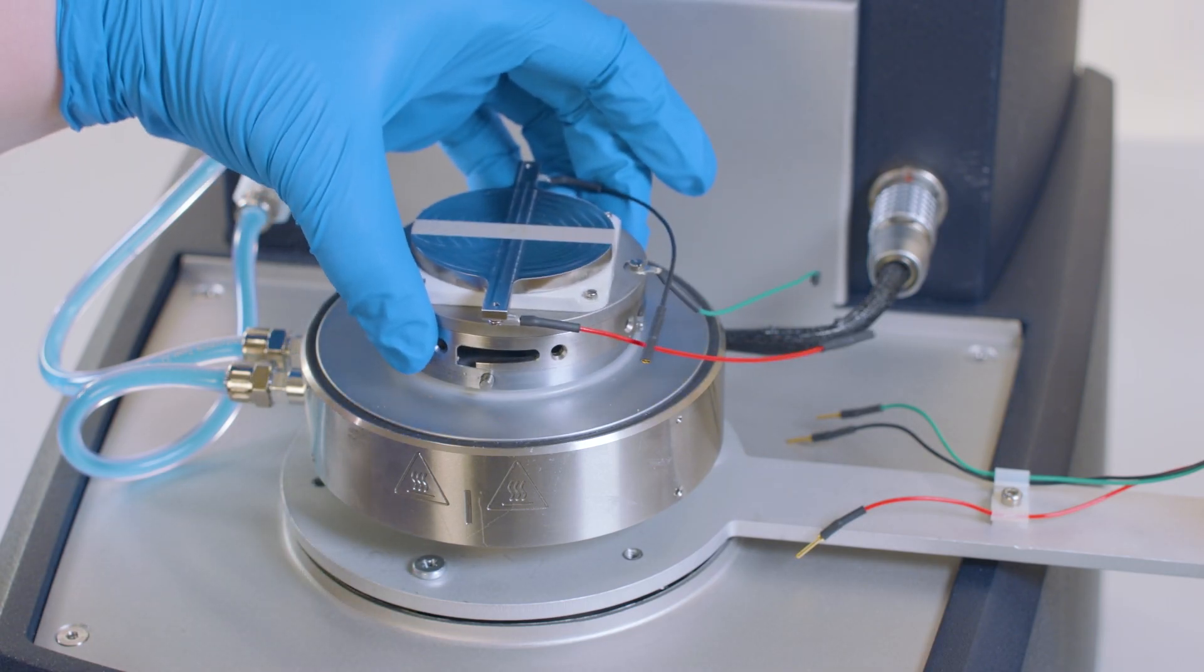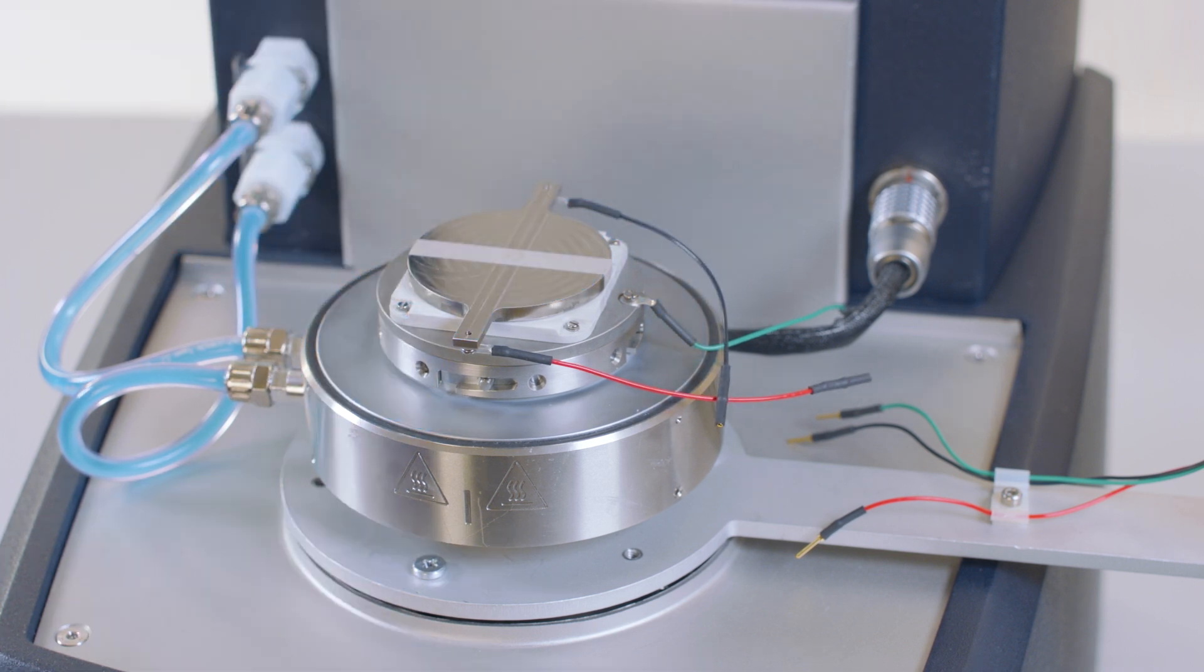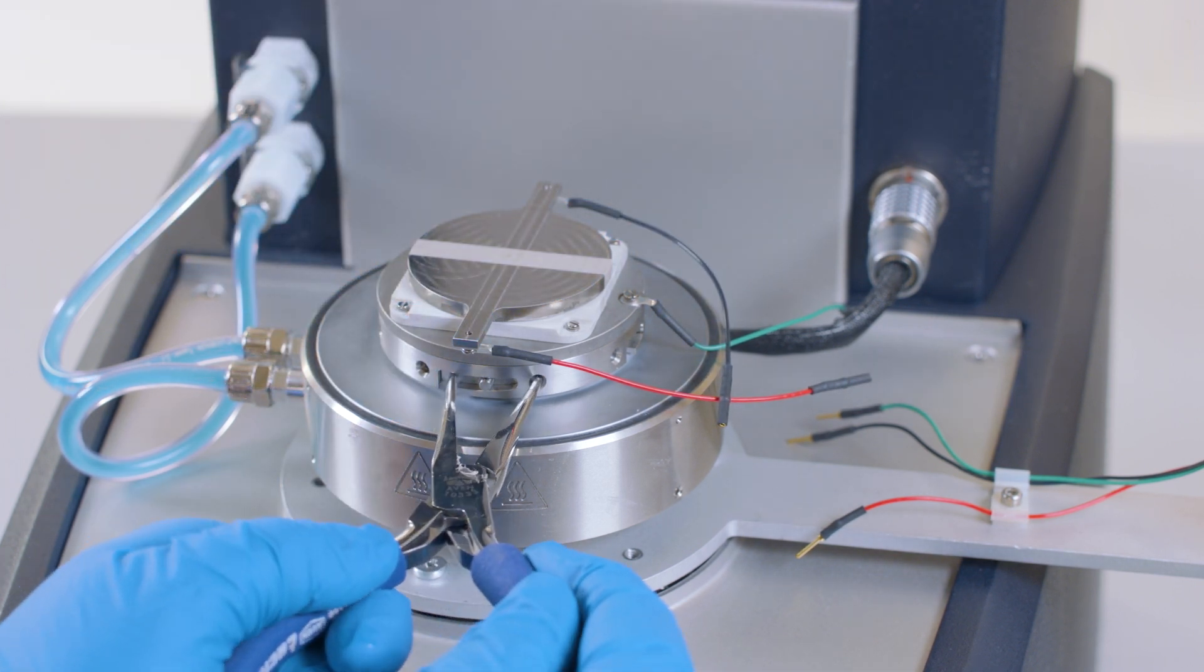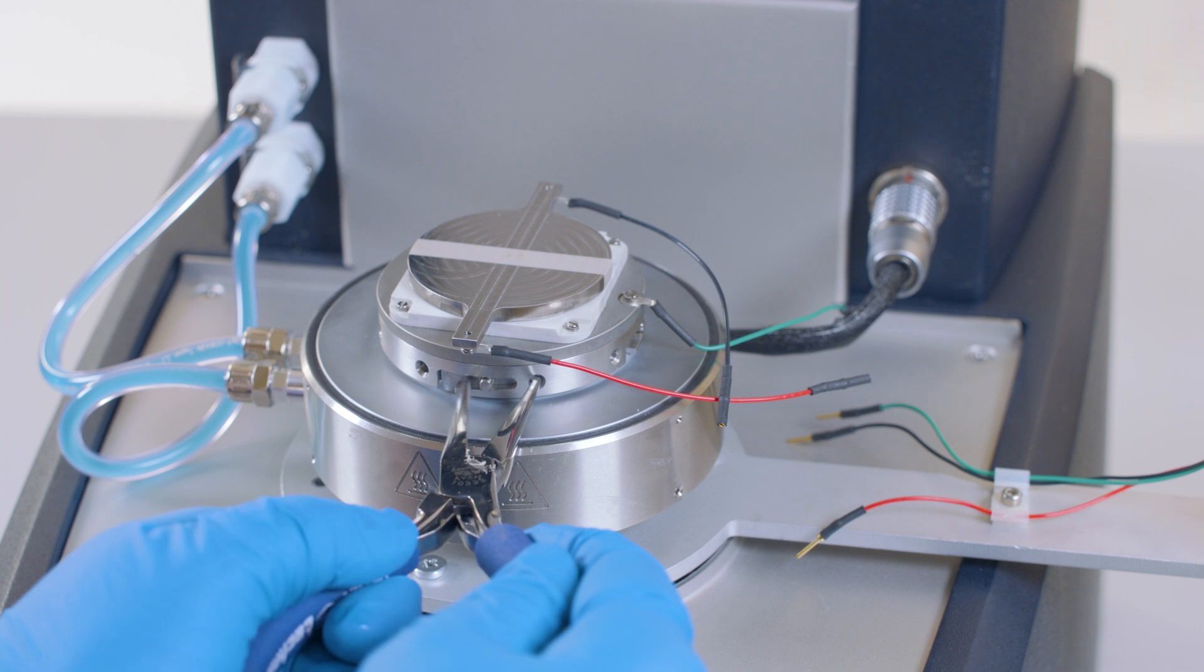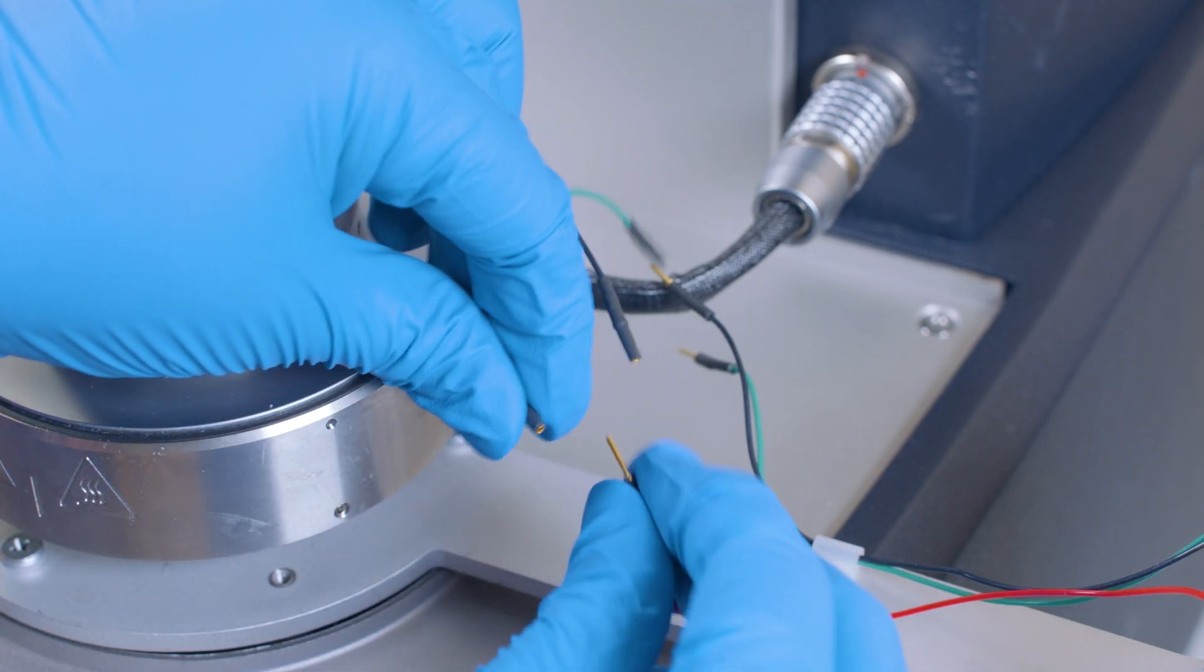Install the RAIOIS lower plate onto the Advanced Peltier plate with the wires in the same direction as the junction box. Rotate clockwise and secure with the provided pliers. Connect the color-coded wires from the lower plate to the junction box.